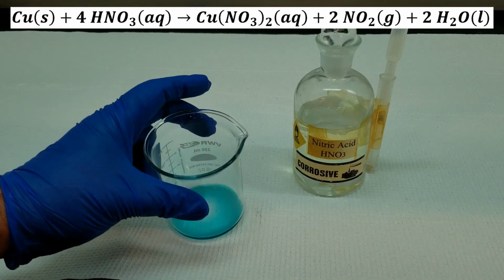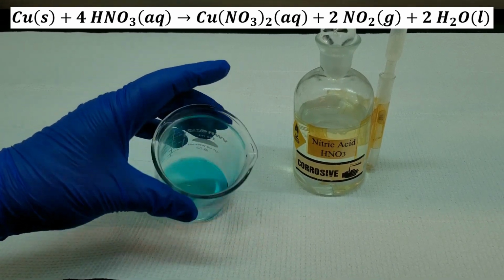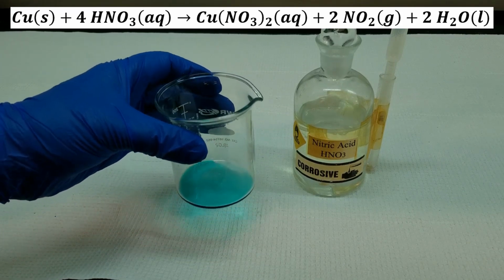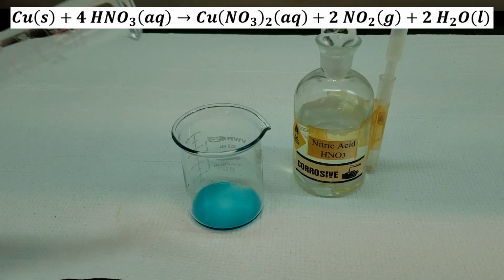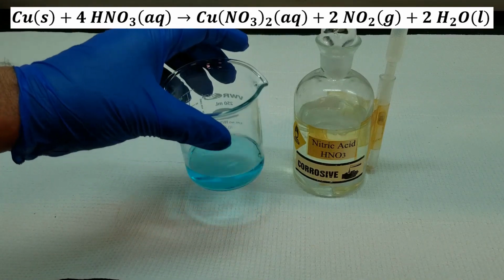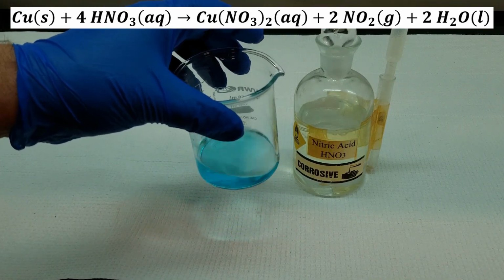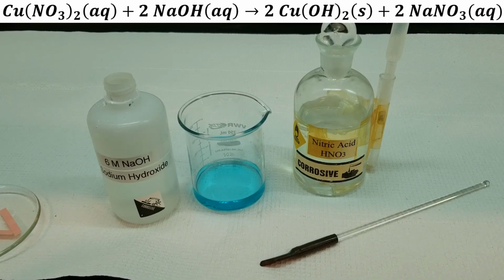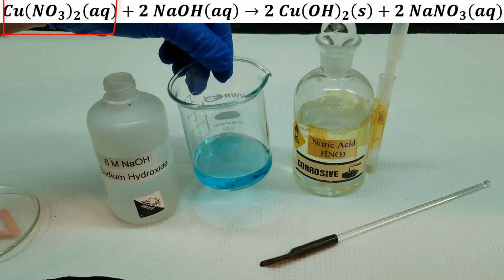Okay, there's our copper metal after it's been dissolved in the nitric acid. It now is copper 2 nitrate. We're going to add a little bit of water to that, and there's a nice blue solution of copper 2 nitrate.